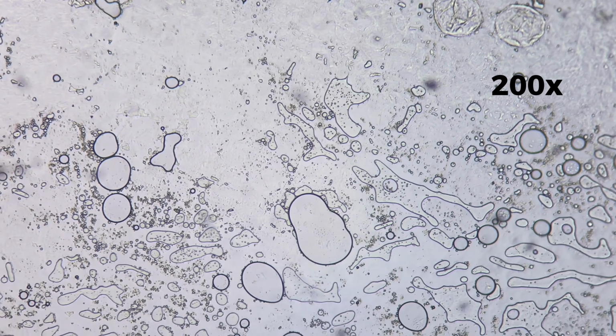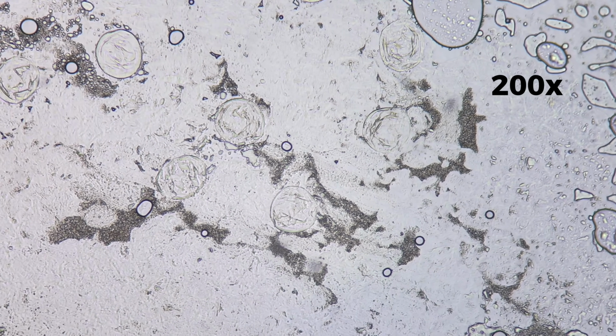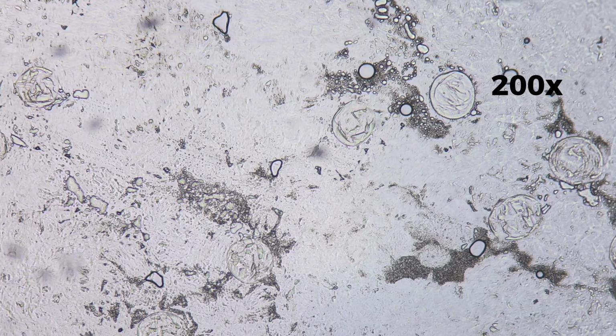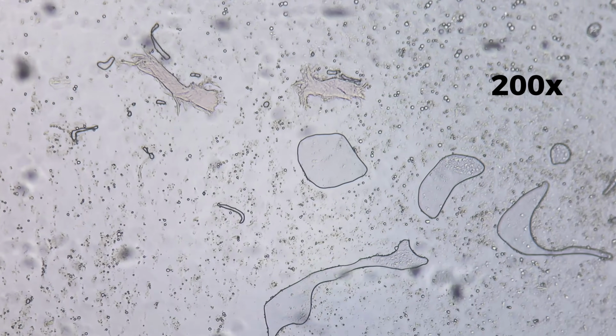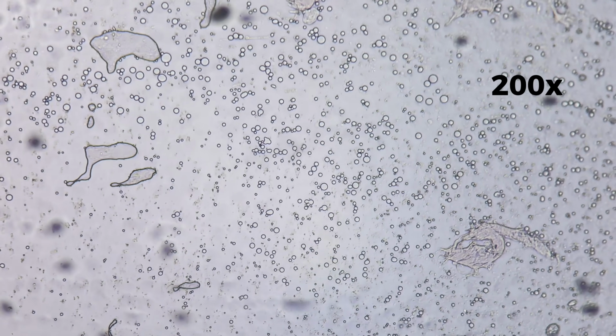The background appears granular and layered, composed of countless tiny elements pressed together. The spaces between structural components appear filled, contributing to the fruit's softness. Some regions look stretched and thin, while others appear thicker and more compact.